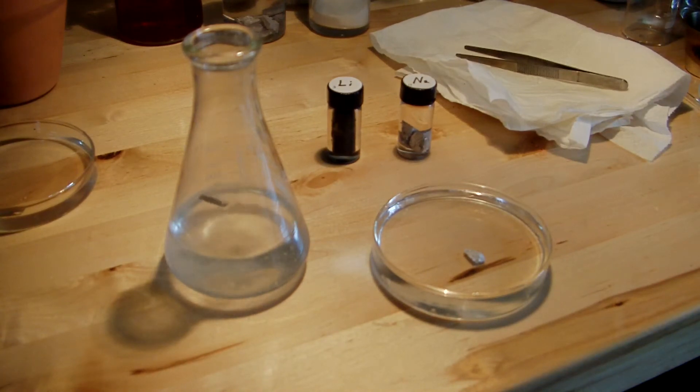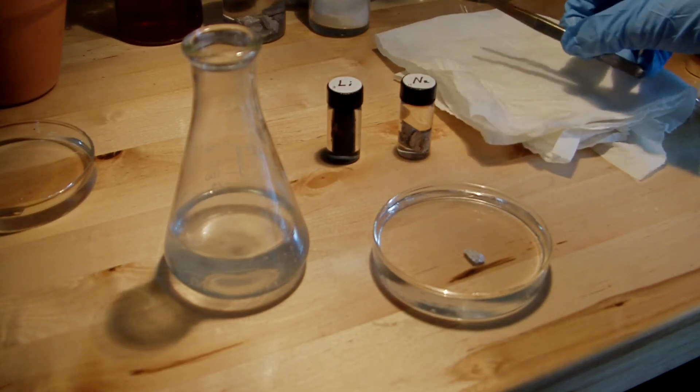So what's happening is the lithium is reacting with water to form lithium hydroxide and hydrogen gas. It's a pretty vigorous reaction and it generates a little bit of heat.